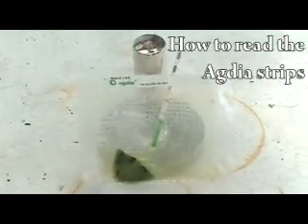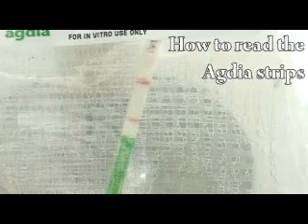I have this one out here in case we want it. So that is cymbidium mosaic virus? Yes, cymbidium mosaic. Here comes that red working its way up the strip — here's the line. It looks like cymbidium mosaic virus. That bottom line is the cymbidium mosaic virus line. This line here is the control line. You have to have a control line show up so you know it's a valid test. Had it had odontoglossum ring spot virus, there would have been a line showing up midway between those two points.